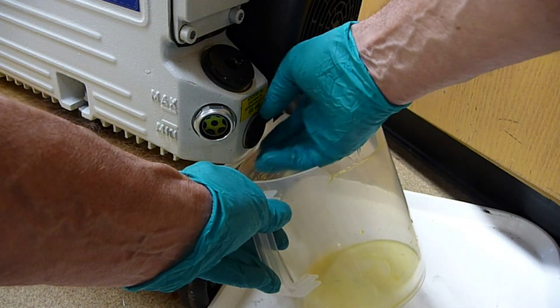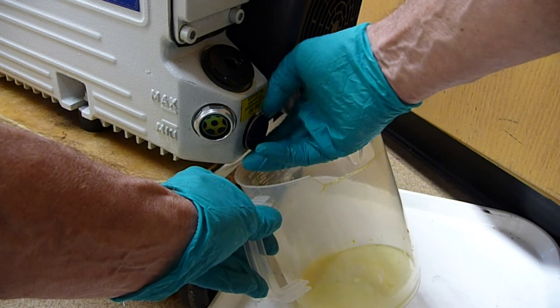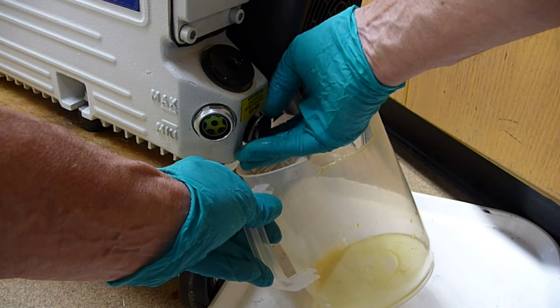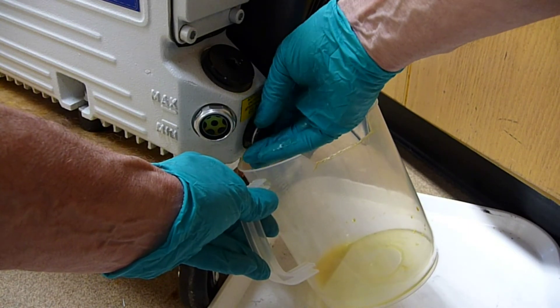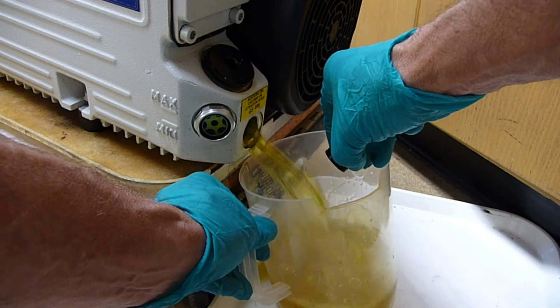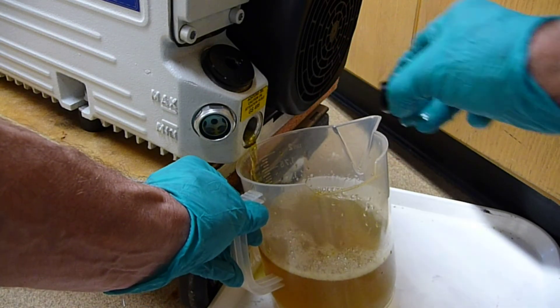Using gloves — the oil capacity is on the order of a liter. I turn this, and it's going to be hot oil. And out it comes.